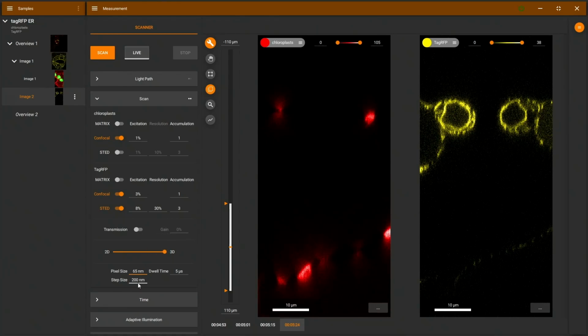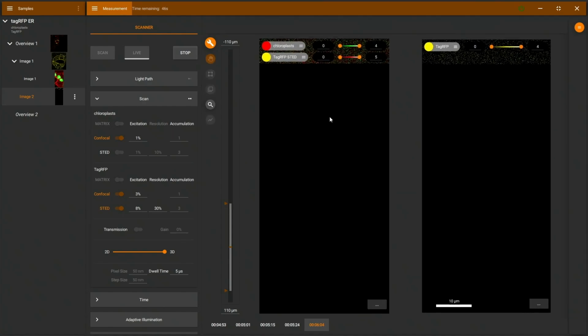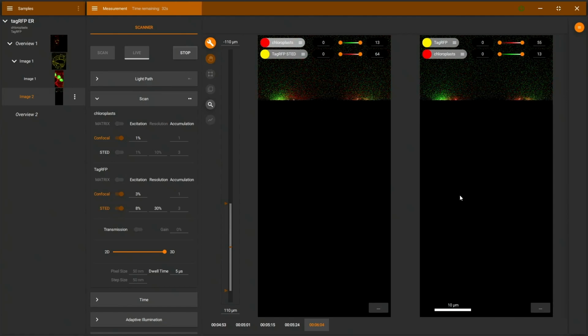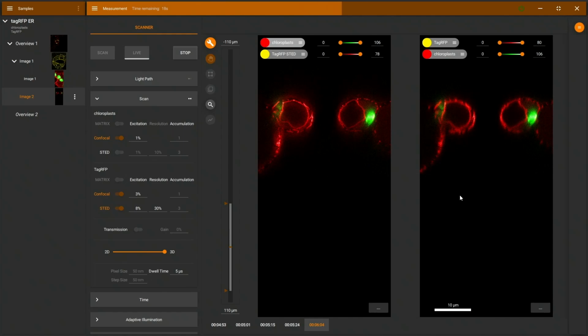And I make the size of the pixels larger in XY because we have less resolution there, but much smaller in Z because we have a lot more resolution in Z when we use 3D STED. You can see this now in the scan. I'm going to overlay the images again, duplicate the autofluorescence channel, and we can see on the left the 3D STED image, on the right the normal confocal image. And we can see a clearer image on the left with 3D STED, more details there.